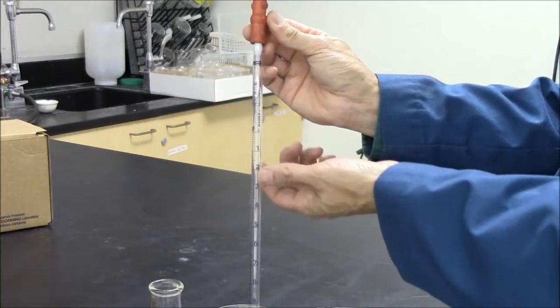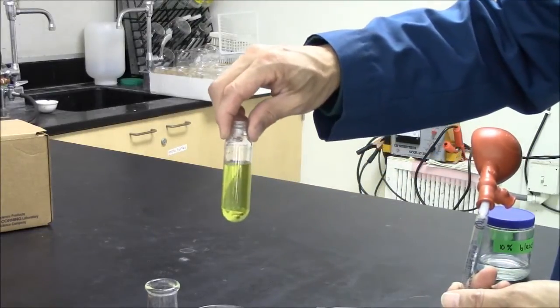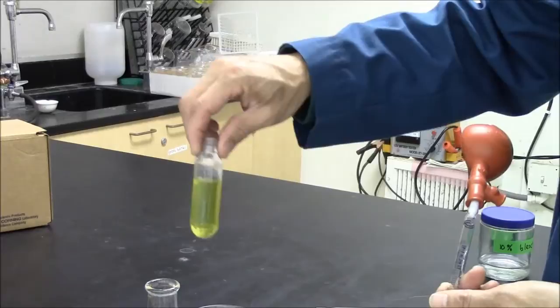So your instructions ask you to make two centrifuge tubes. 20 milliliters of broth will look like that in your centrifuge tube. So two tubes like this.